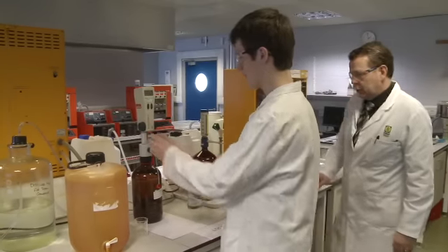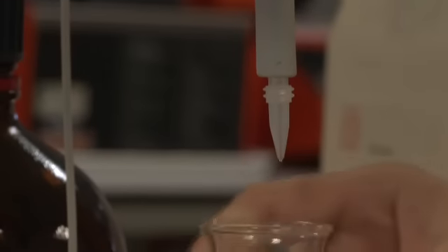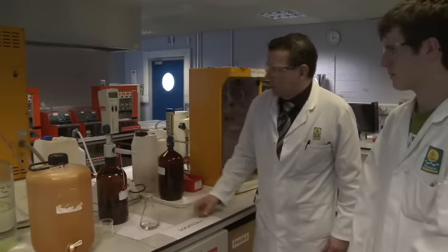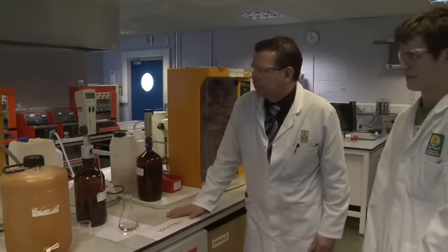This can now be titrated against 0.1 molar hydrochloric acid. The indicator contained within will change to a faint pink colour when the endpoint is reached. The endpoint can be read directly from the digital burette. The endpoint has now been reached and can be read directly from the burette, in this case 5.58 ml.